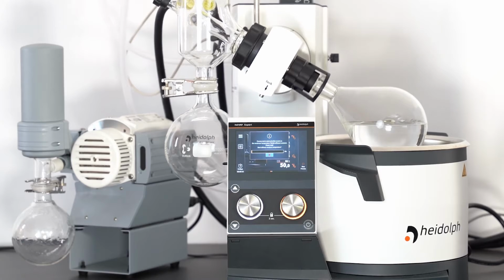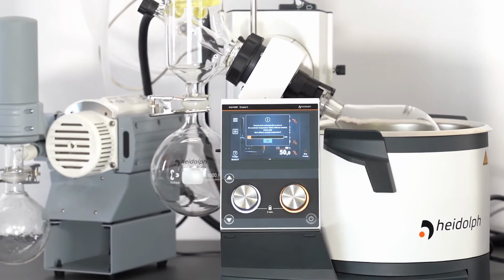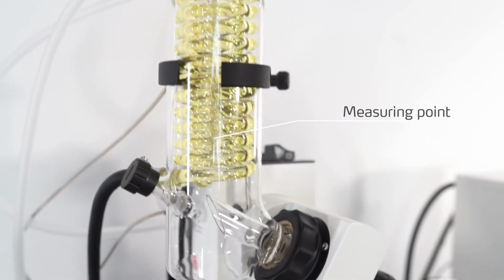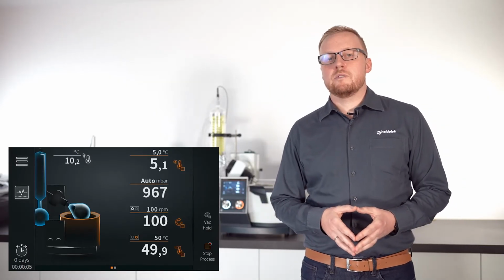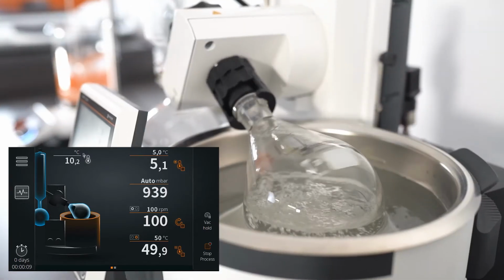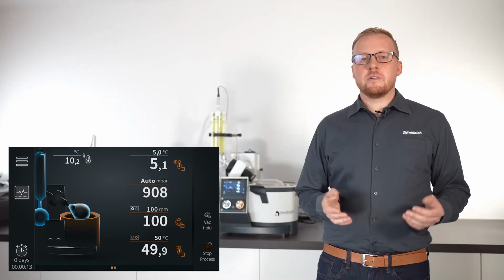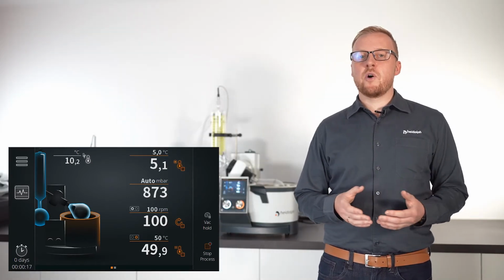The process starts with an automatic self-check to ensure that the temperature at the most relevant position, which is the lowest point of our condensation zone, is stable. If this is the case, the program now starts to search carefully and slowly enough for the right vacuum level in order to trigger the initial boiling. This is very important to avoid a too fast evacuation, which could lead to the occurrence of foam or splashes.